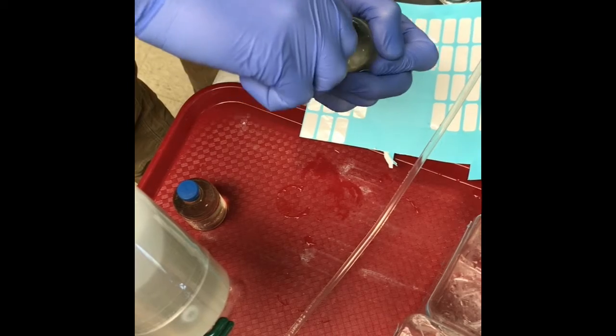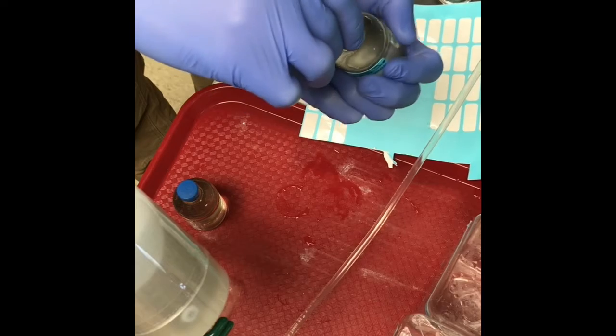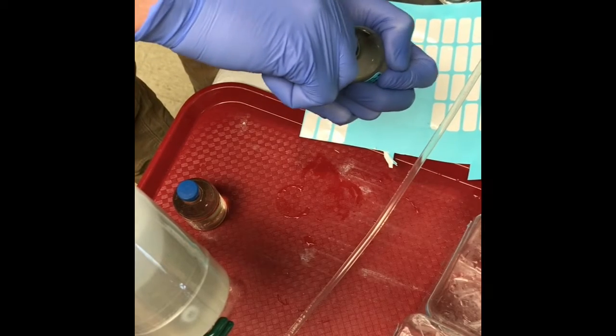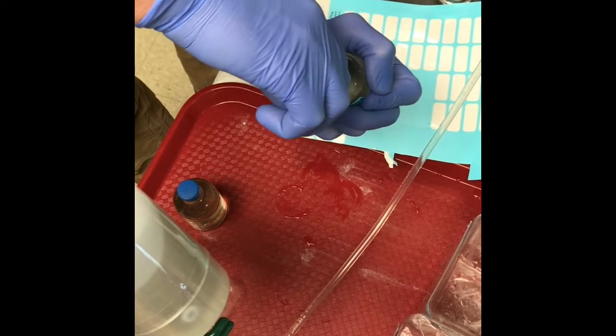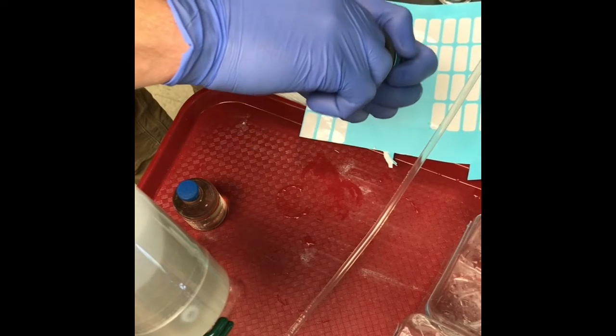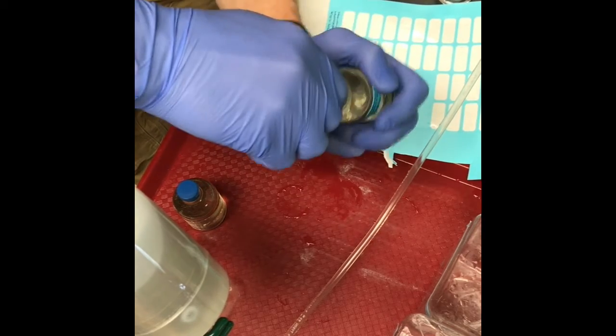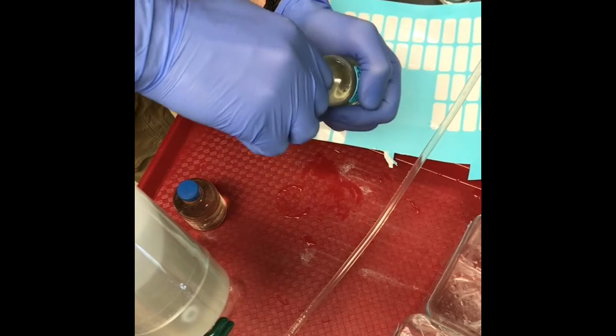A little bit of wastewater might come out too, but that's not a problem. I'm just trying to make sure we don't allow any oxygen to stay in there that would compromise the sample.